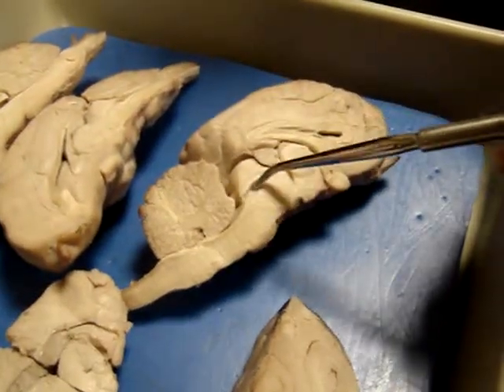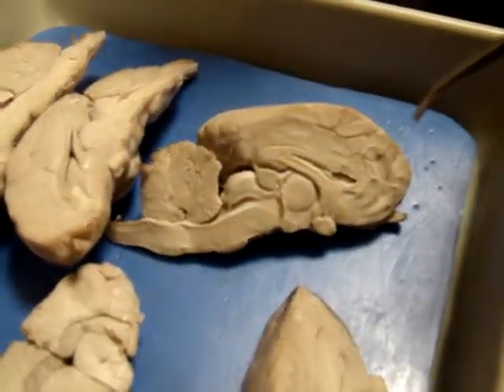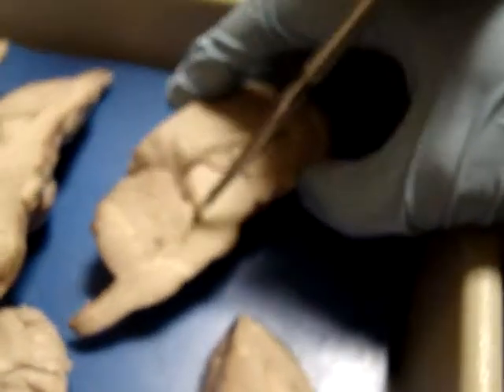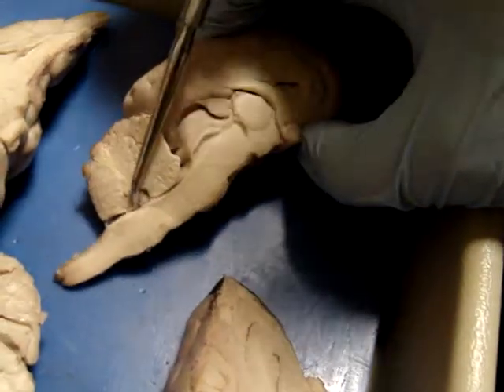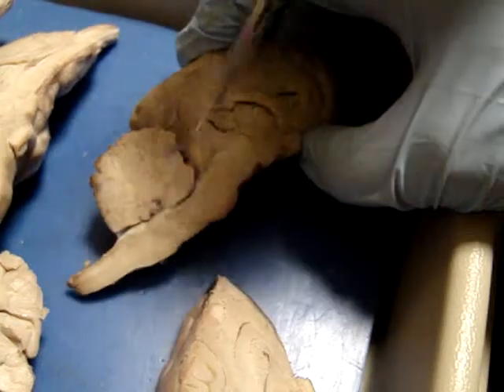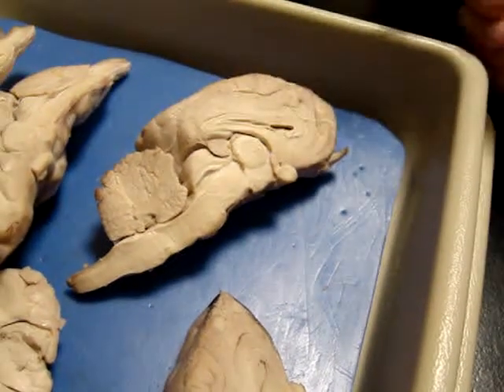You can actually lift up the cerebellum, like we lift up on the other side. Do that, or just up underneath the base of the cerebellum, further down. There you go, right up in there. Right up inside there. The fourth ventricle gap is all up underneath there. And remember, the ventricles are what produce the cerebrospinal fluid.